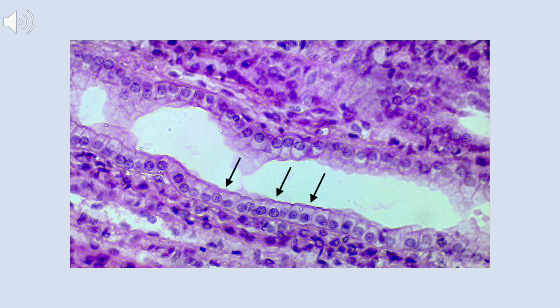Similar to the last slide, we have a longitudinal section of something that is long and cylindrical, and there's going to be free spaces in it. Now, we can only see one free space where the arrows are in this image, but if we were to expand this view, you'd probably see some more. So, if there's a free space, then that tells us that we are looking at an epithelium. At least that's what's indicated on this one.